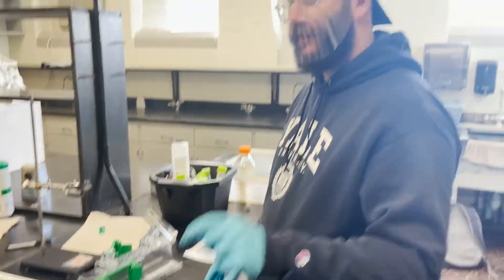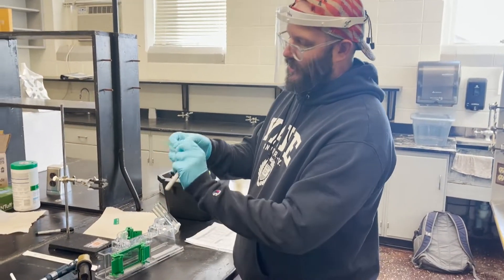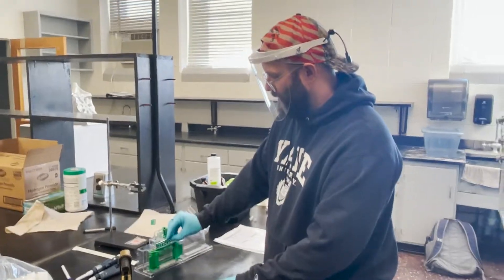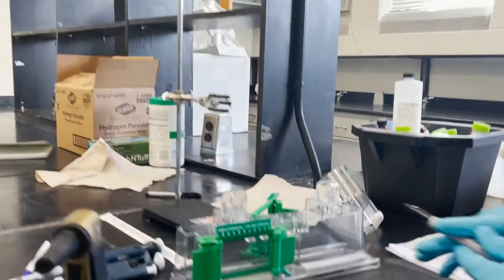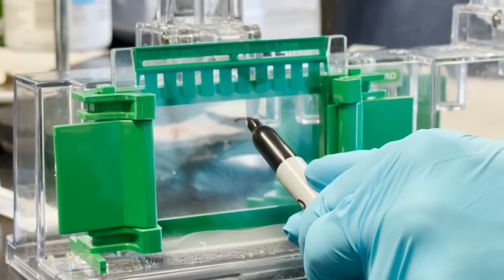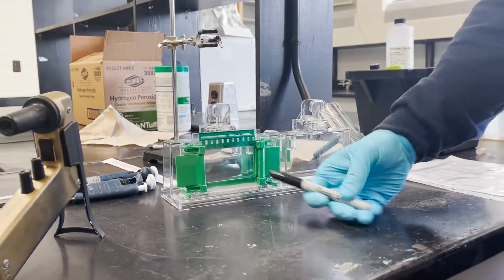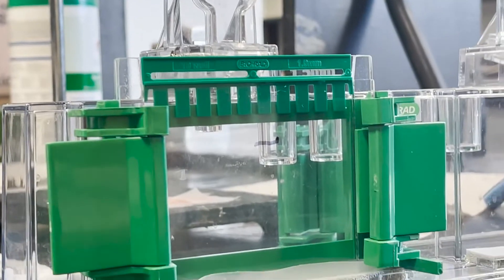There are actually two pieces of the gel: the bottom part and the loading gel. The loading gel is going to be the size of the comb to load your samples. You put the comb in there and make a mark a little bit below the comb to show where to pour the gel. When you pour the gel, you want to pour it a little bit above the mark because when it polymerizes, it'll shrink up.